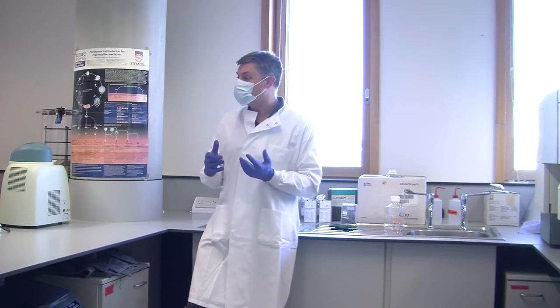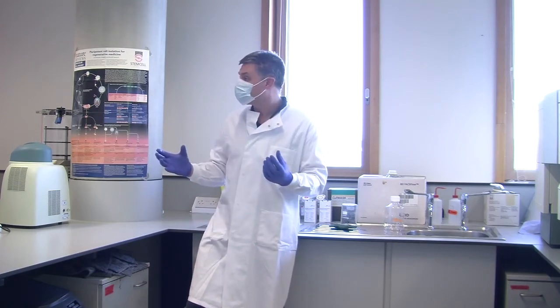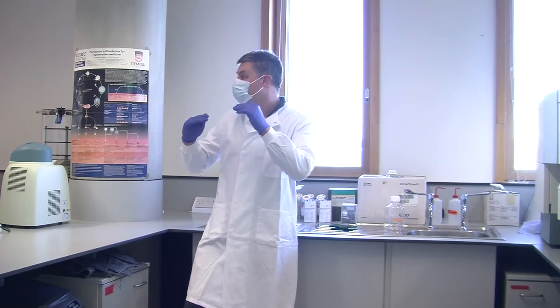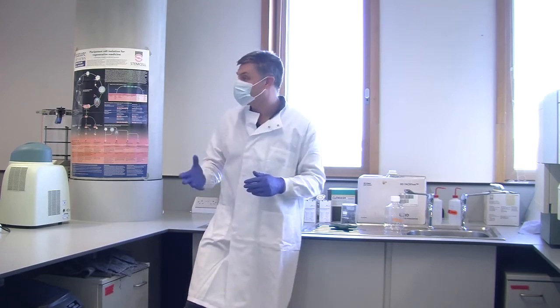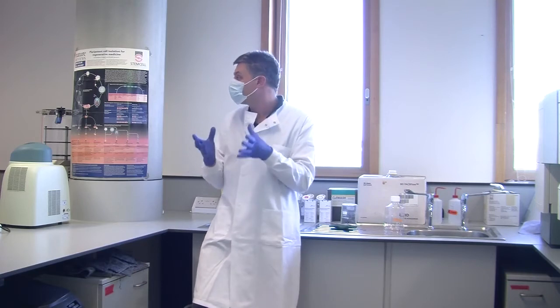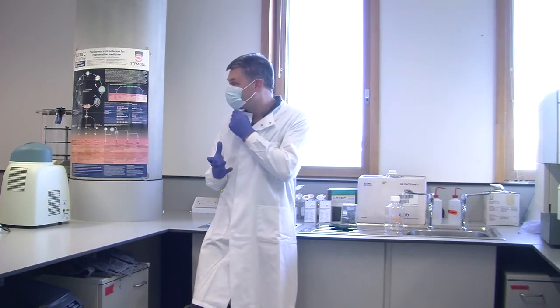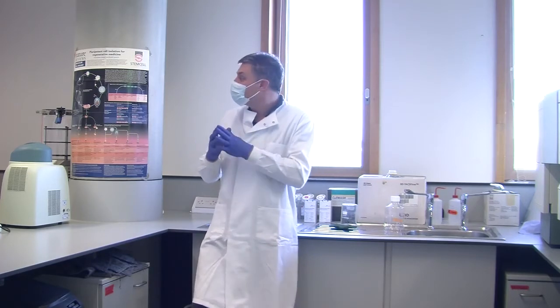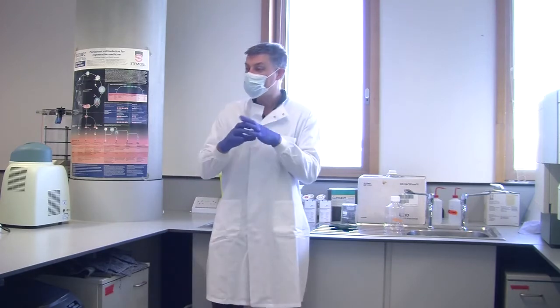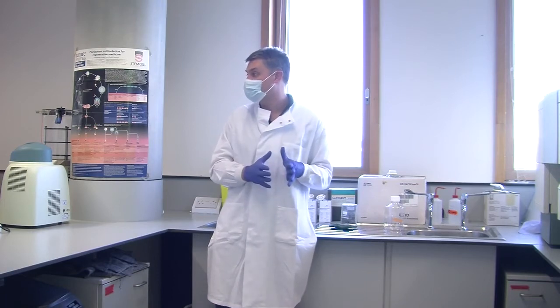In diagnostics, it's used to look at HIV status, because you can label your CD4 T cells one colour, your CD8 T cells another colour, and you can see what ratio you get between them. And that's the important thing in HIV. If the ratio's level, the patient's fine. If one of them starts accelerating on the other, that's when the patient will get sick, and you treat with drugs. You can look at leukemias, you can diagnose those by looking at what surface markers are on the blood cells. It's heavily involved in the latest COVID research, and obviously it would be stupid not to take the opportunity to mention that. It's used in that because you can look at the response to the virus, you can look at cells that express it, you can look at T cells that are specific for it, and so on. So because you can look at one cell by one cell by one cell, but very, very quickly, it's an incredibly potent technique, incredibly potent system.